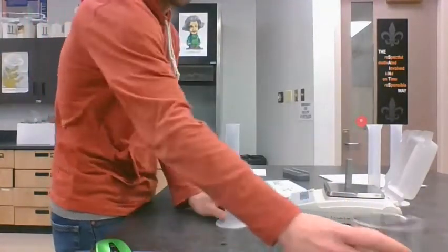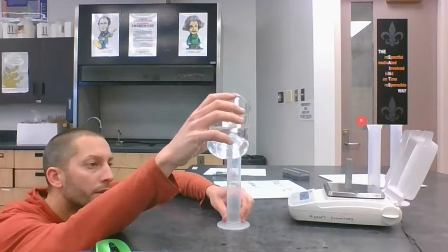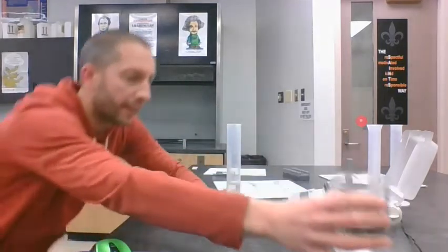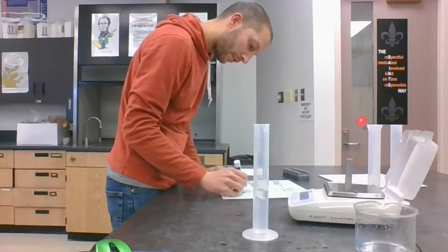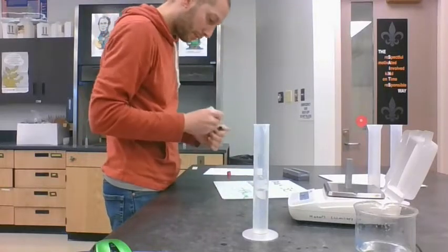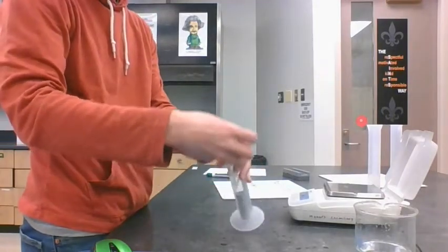Okay. And then we'll get the volume of that. All right, that is at 49 exactly, or 49.0. Drop that in slowly if I can.